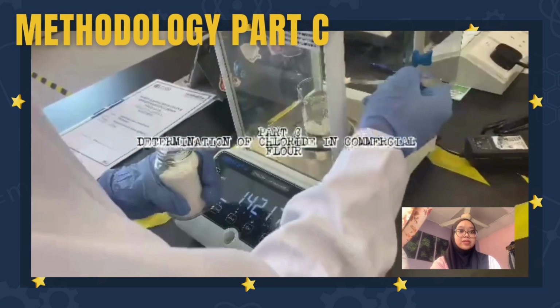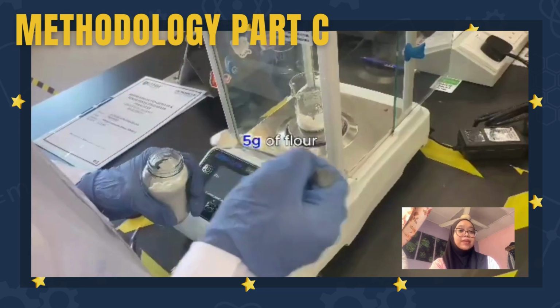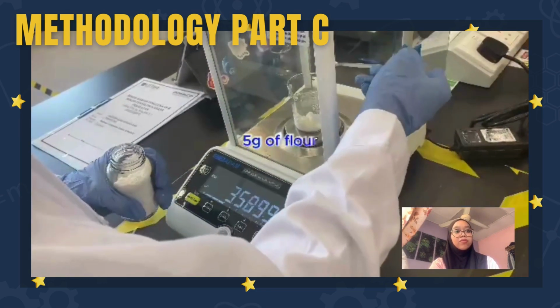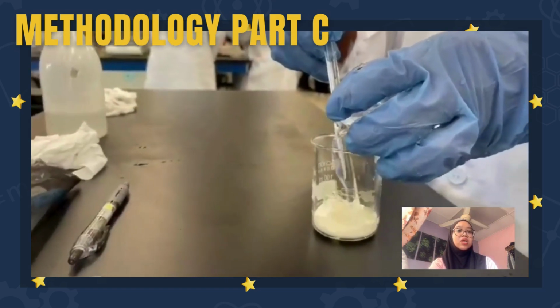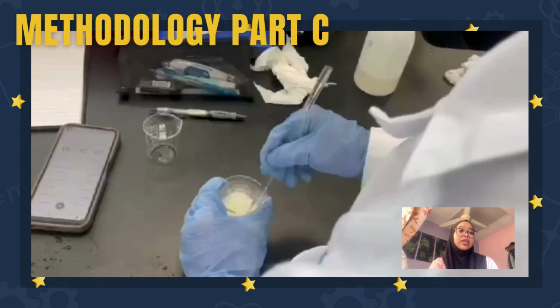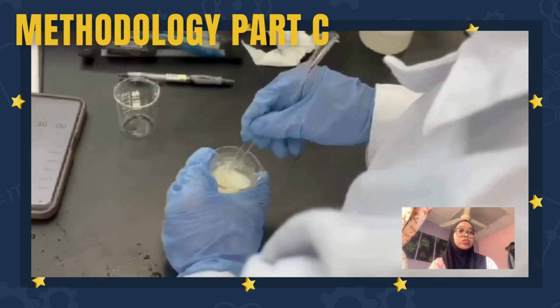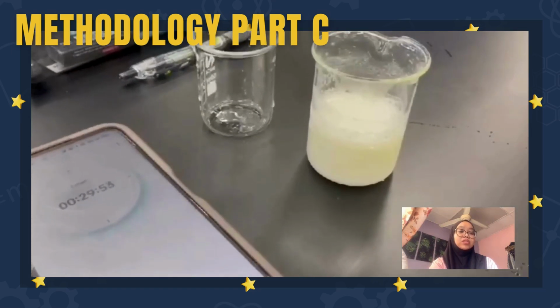For part C, 5 gram of flour was weighed using an analytical balance. 50 ml of distilled water was added to the beaker and the mixture was stirred to dissolve the sodium chloride present in the flour. It was set for 30 minutes to ensure full dissolution of the salt.